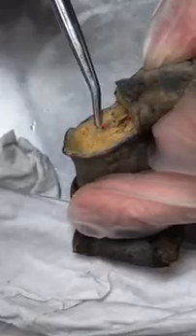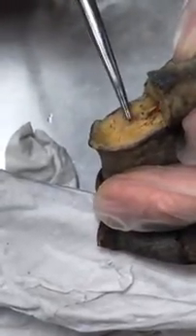If you look at the cut in the tail, you can see the caudal artery, and then the caudal vein doesn't have dye in it, but it's just the hole adjacent to the caudal artery. Post-caval vein is like posterior vena cava. Any questions?